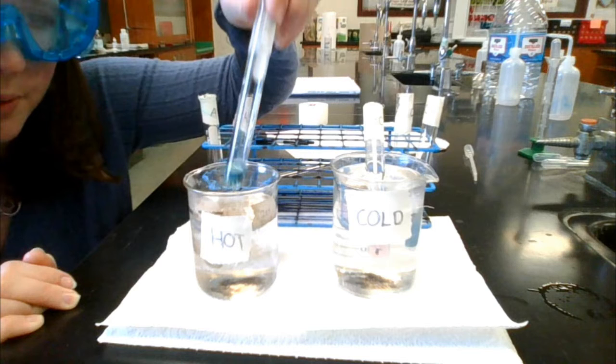So this started to form the hydrate ion of the cobalt more prevalently than the cobalt tetrachloride, so the red color is obviously more prevalent here. But so anyway, what's happening with the heating and cooling is, since it's such a close ratio of the chloride and the water, this allows it to very easily switch between the colors with heating or cooling. So the heating, you can see this endothermic much more clearly with it turning to blue from the pink, and then you can't see it very much because of the weak saturation of the pink in terms of color, but it does turn more strongly pink.